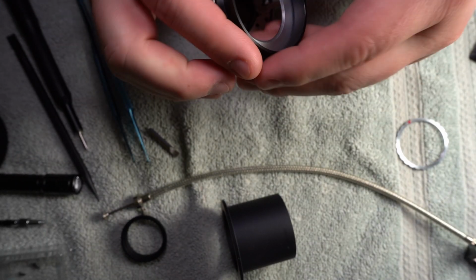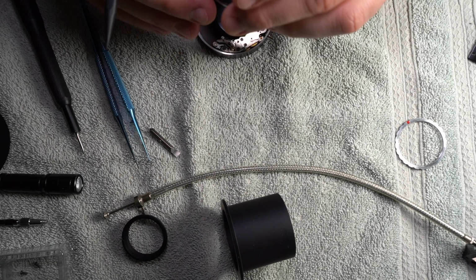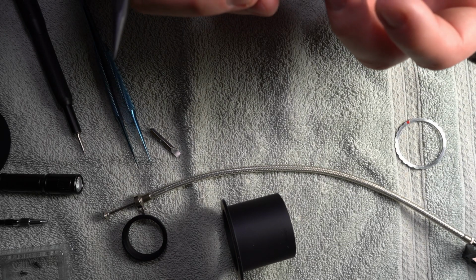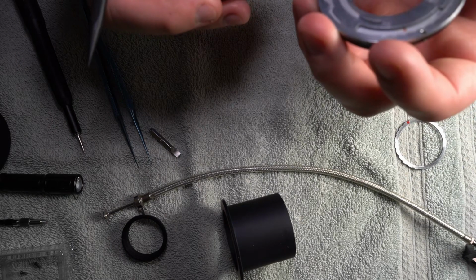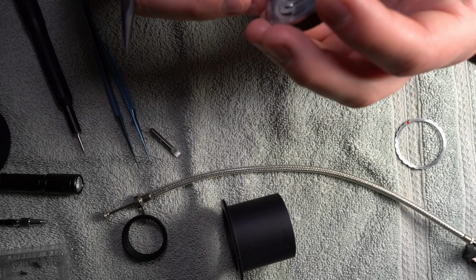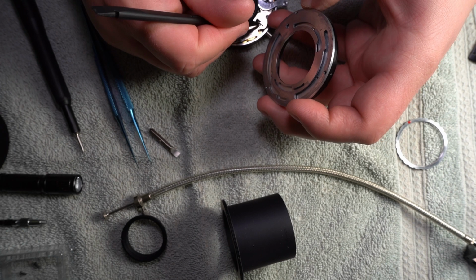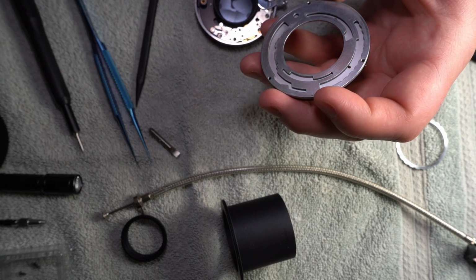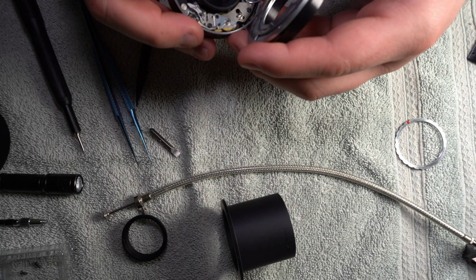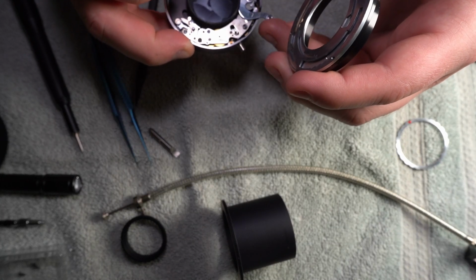I moved this inner ring here, it moves a little bit. And it does that. So those are alignment points. That's gotta be. Does that move? It does move. Wow, that moves a lot.